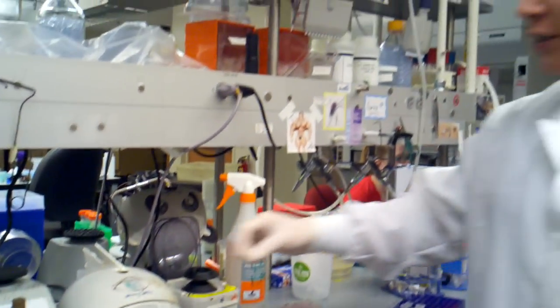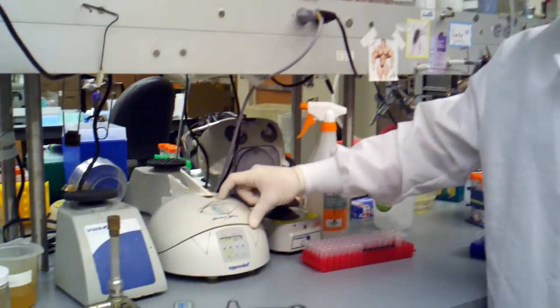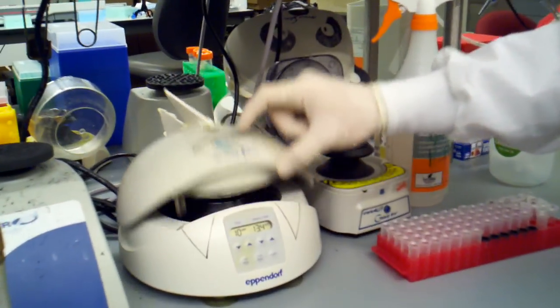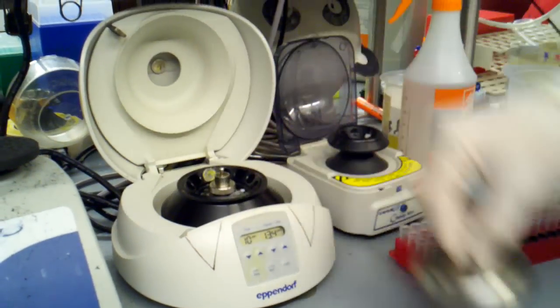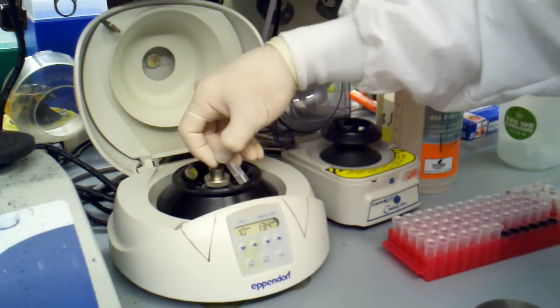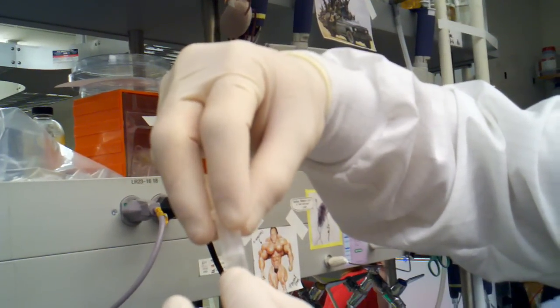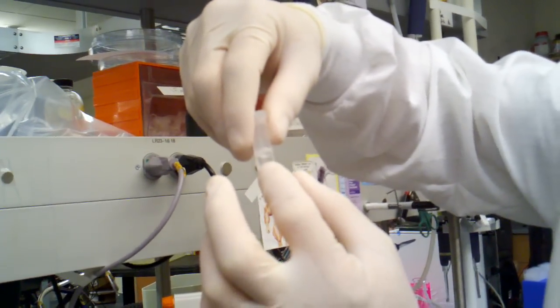Hi guys, we're going to finish up our DNA mini prep for plasmid DNA. We just finished our 10-minute spin. If we take a look at our sample, you'll see there's a bunch of white junk at the back and some clear stuff at the front. We want that clear liquid.